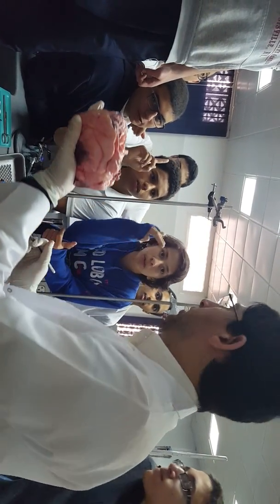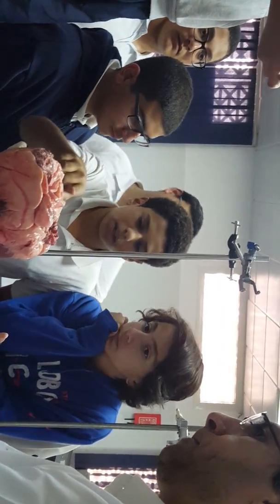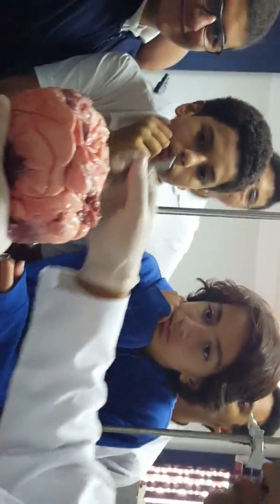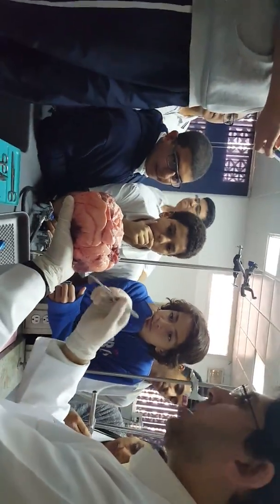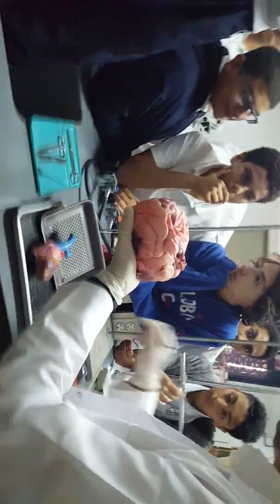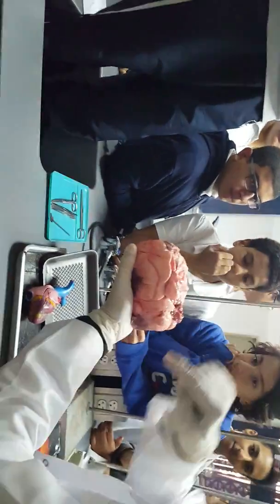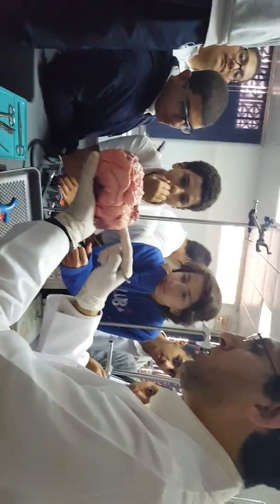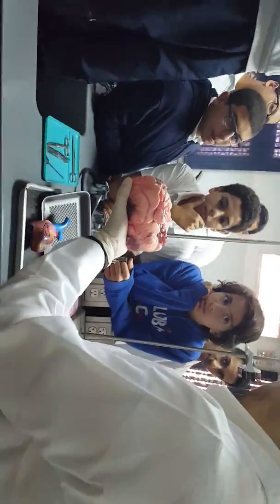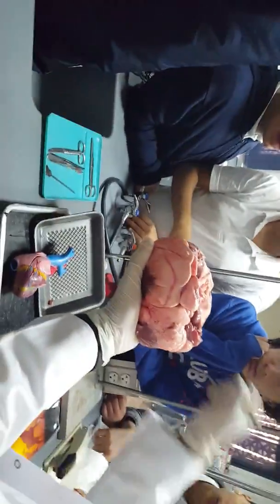Okay? Any questions? Yeah. Teacher, at the beginning you mentioned that the heart has a lot of fat. Isn't that can also have damage on it? No, the fats are surrounding the heart in order to support the muscle itself with a high energy level of material. No, it's not in the cells, just surrounding. Because when it needs energy, it will take from this, because it gives the heart a high energy level. And also insulation and protection against the frictions.